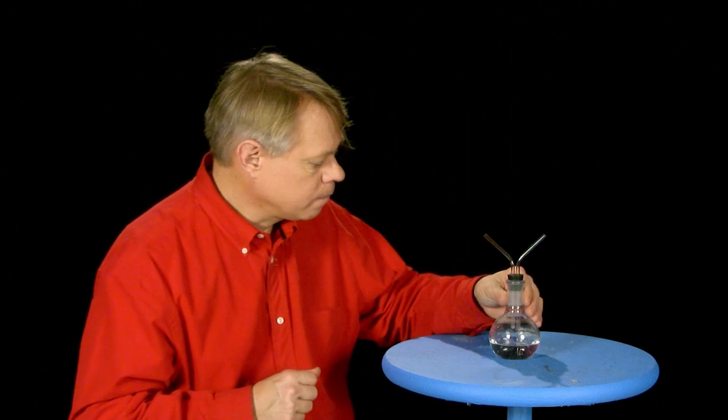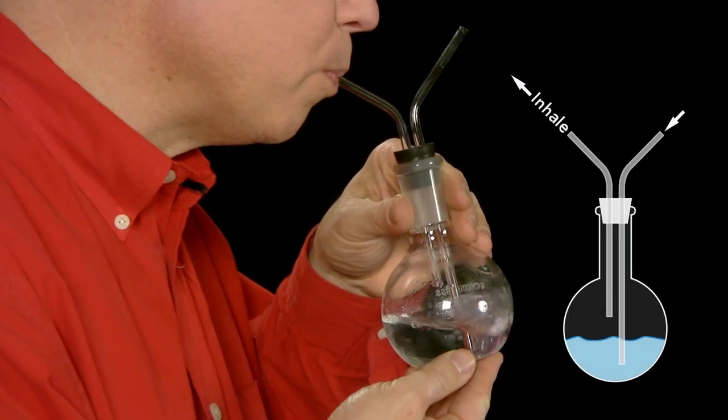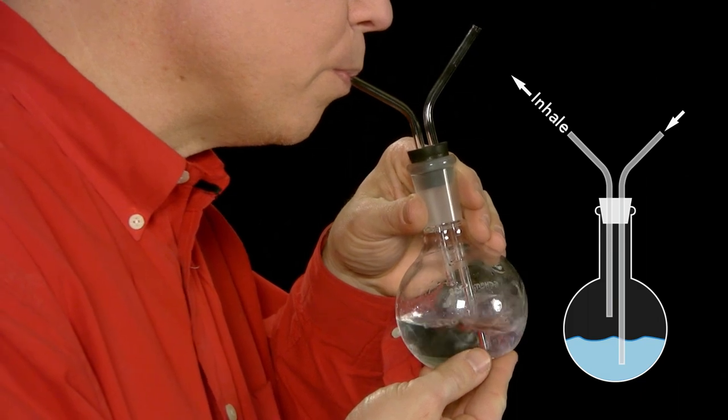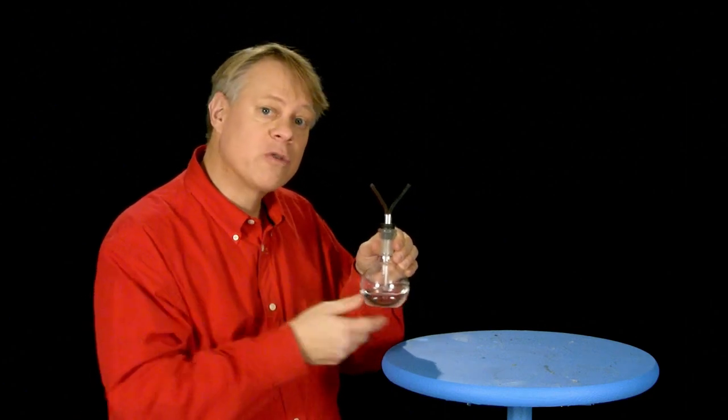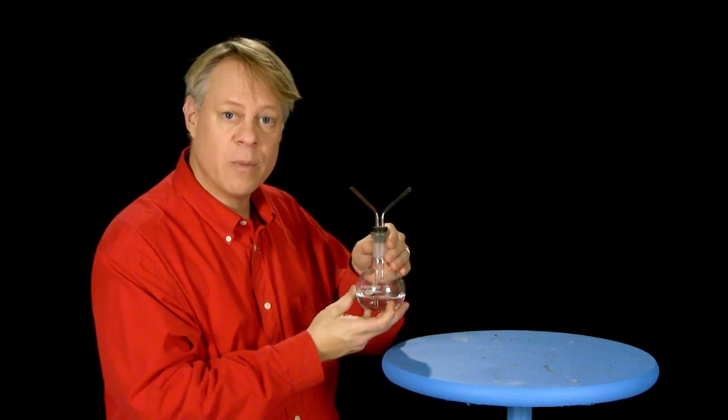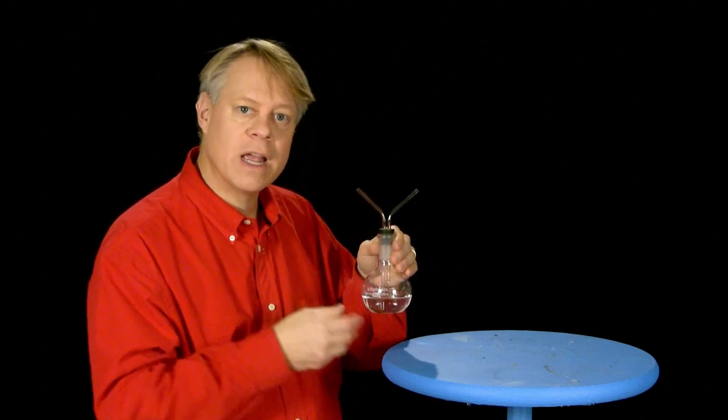You will observe that however long I draw the external air into the lime water and then through it to my lungs, I shall produce no effect upon the water. It does not make the lime water turbid, but if I throw the air from my lungs through the lime water several times in succession, you will see how white and milky the water is getting, showing the effect which expired air has upon it.